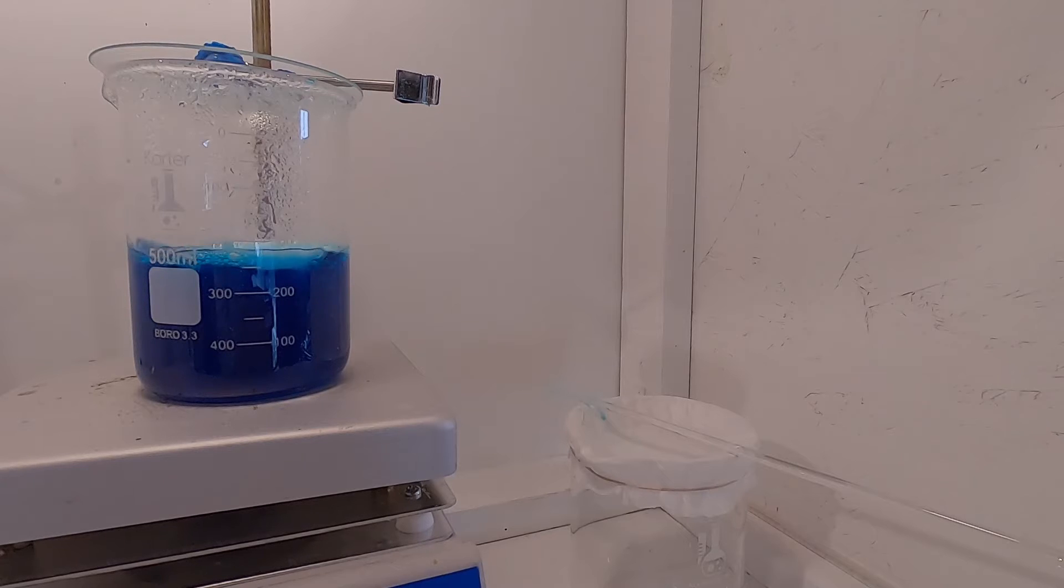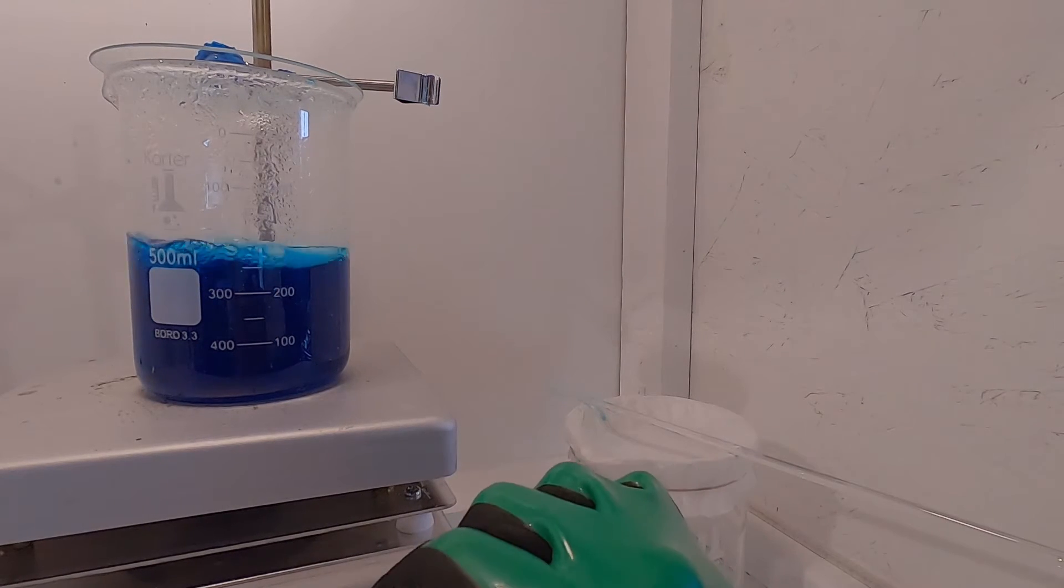Once dissolved, I quickly pour the solution through a filter paper to eliminate any undissolved impurities.